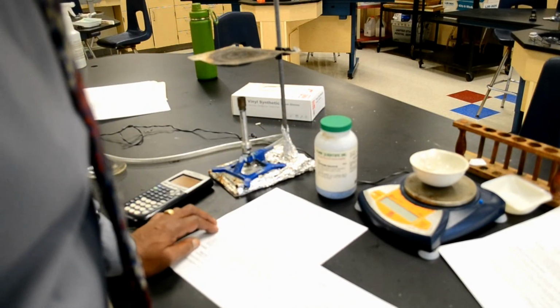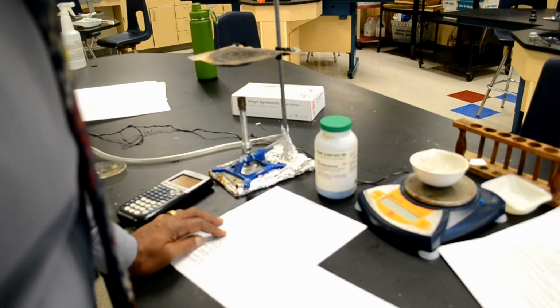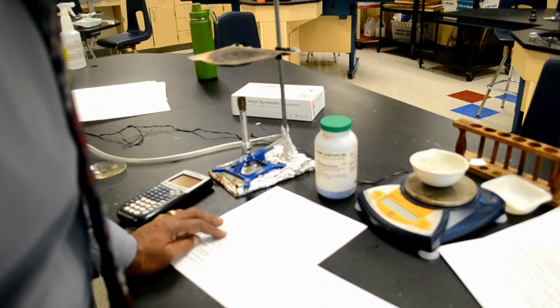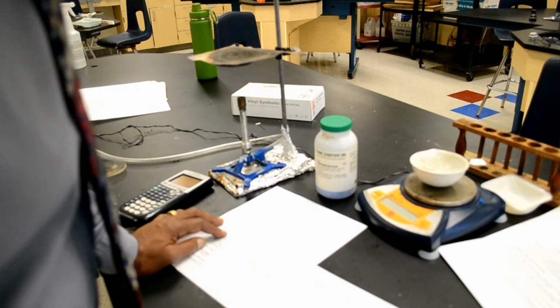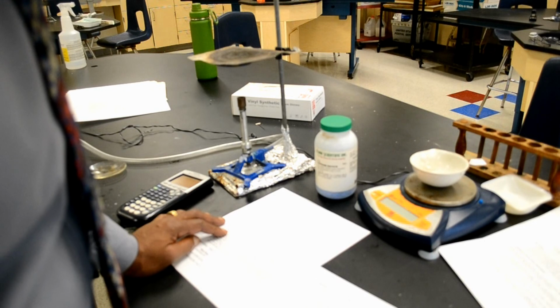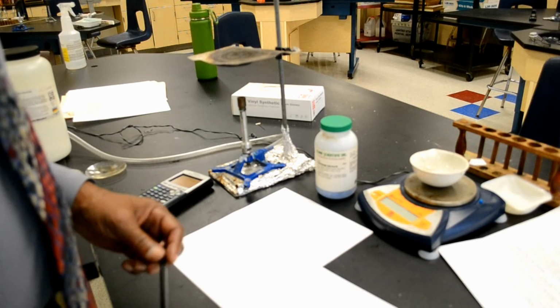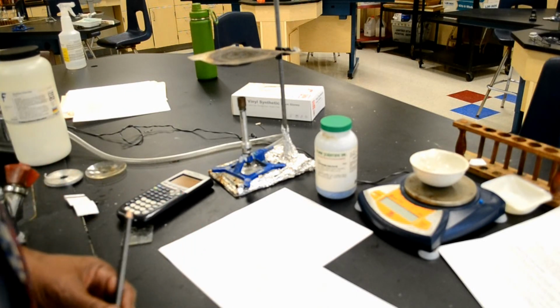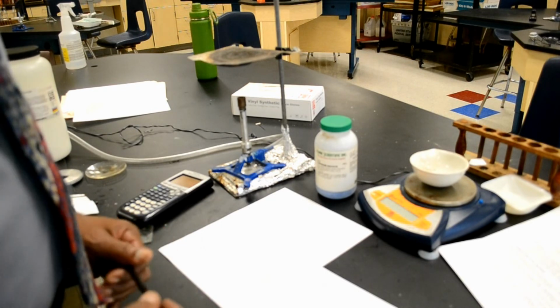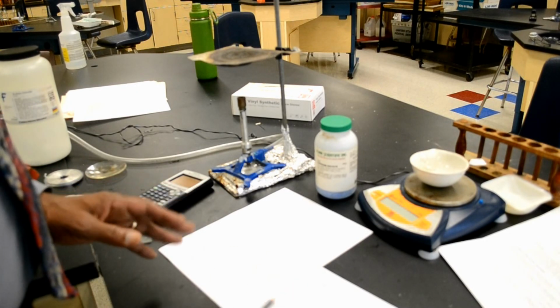So I guess I'm off a little, I guess I rushed it a little bit. But anyway, basically what I calculated was CuSO4·2H2O. It should be CuSO4·5H2O. So I kind of messed this up. At any rate, that's how it's done. And so just remember, be careful. We're very limited in time here, so I had to fudge the experiment a little bit, and I paid for it with these bad results. But anyway, that's exactly how you do it.